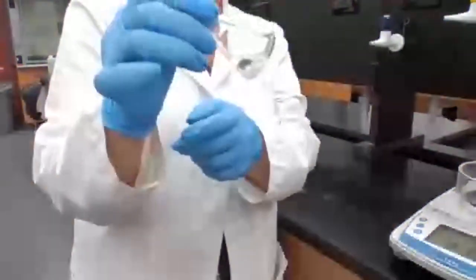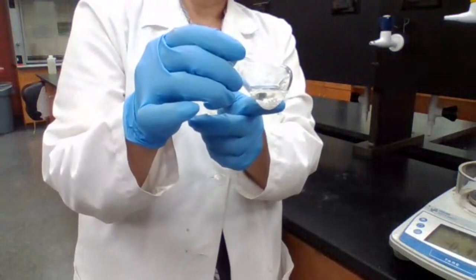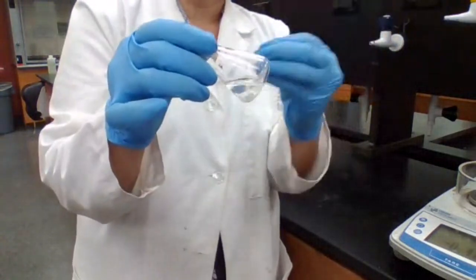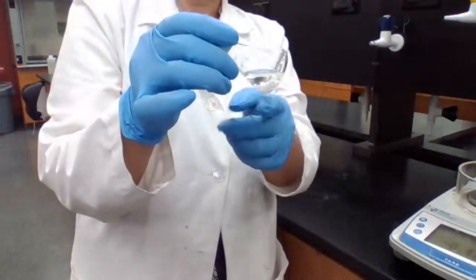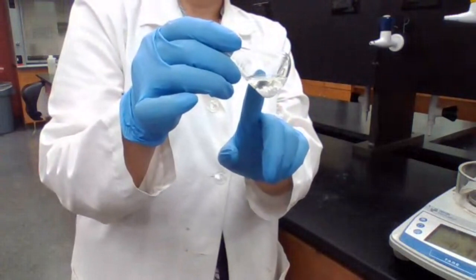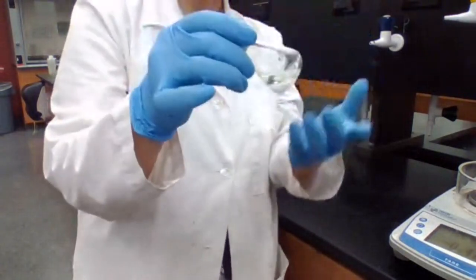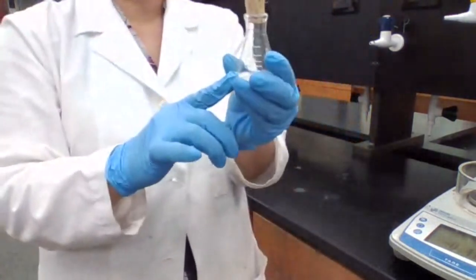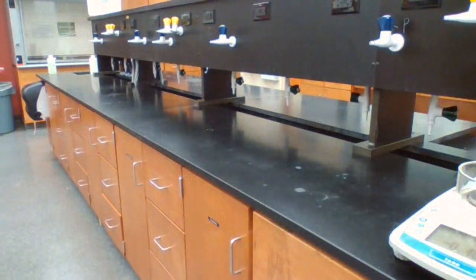We want to separate the catalyst. The point is to recognize that calcium chloride is not your product. Calcium chloride is just something to absorb the moisture from your product. So in order to measure the mass, you first separate that. And then when you separate, you measure the mass of the liquid portion only. You can use either a beaker or a flask, but for transferring purposes, a beaker is easier.